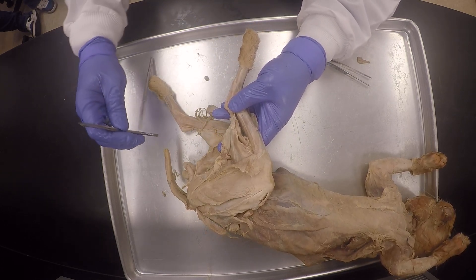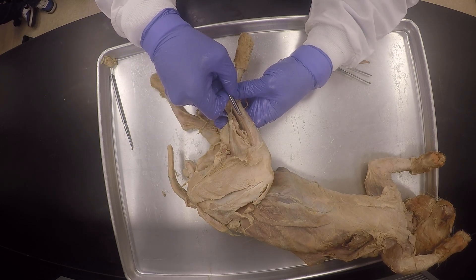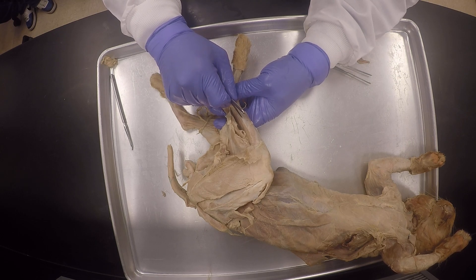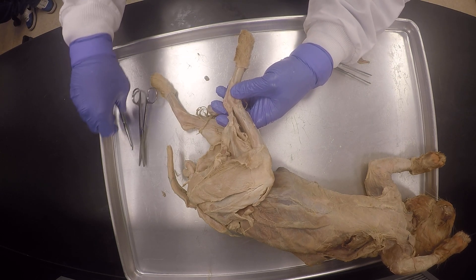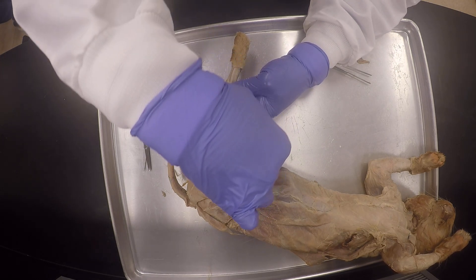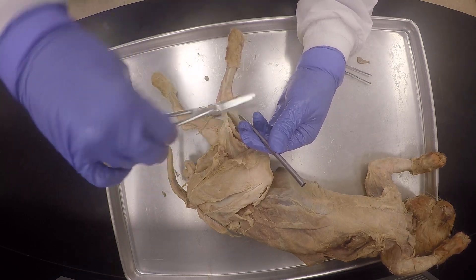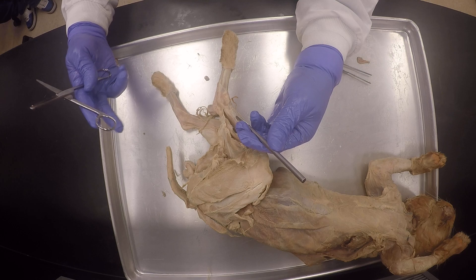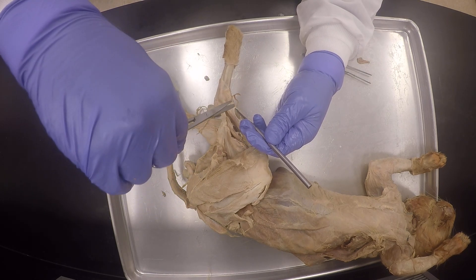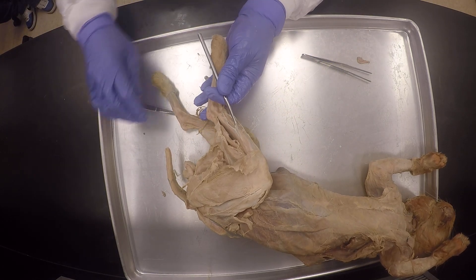So we're going to do this. Like I say, I have to be patient. I use my sharp end very sparingly. When I do that, I go in there — this connective tissue is tough. So you don't want to just try to pull it apart because then it's going to damage your muscle. You must always want to cut carefully, and then you get this.